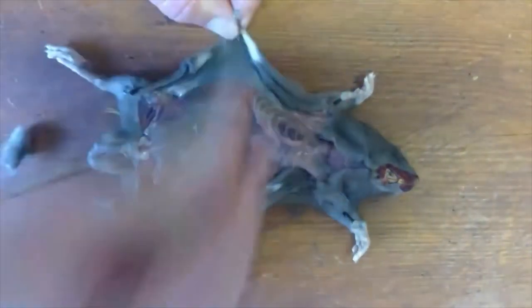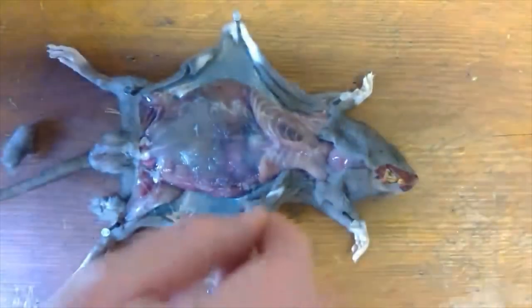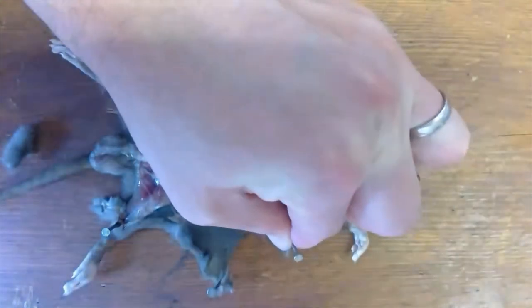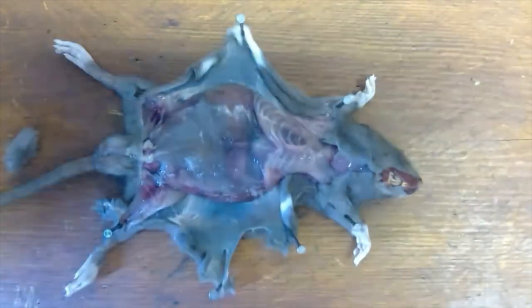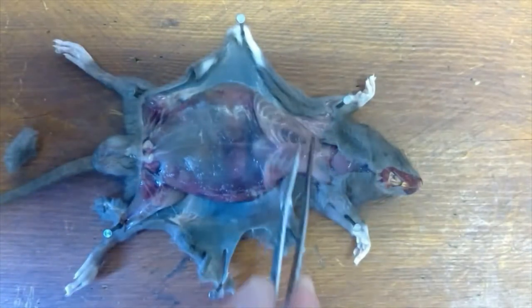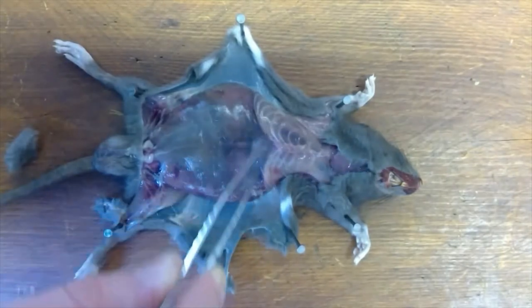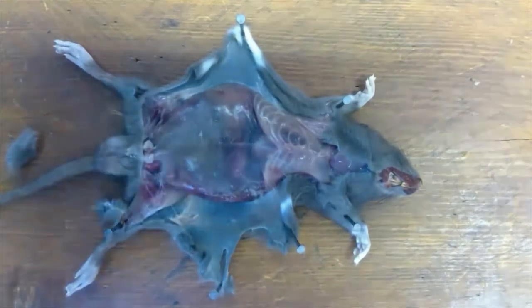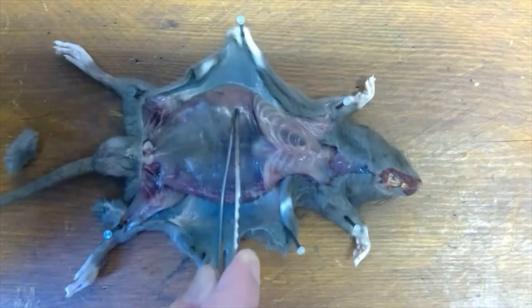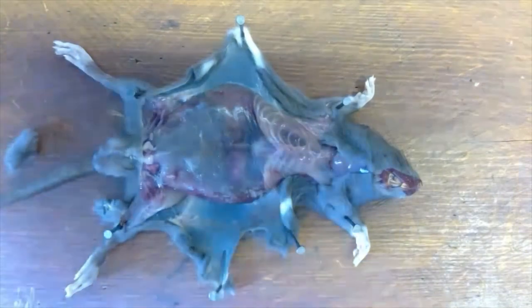I'll nail that in just so we can keep tension on it at all times, then pull on this side, allowing me to expose the organs on the inside. What we can see now quite clearly are the two cavities within a mammal: the thoracic cavity at the top, with the rib cage defining its boundaries, plus the diaphragm sitting beneath — that's involved in breathing. And then here is the abdominal cavity, which contains the organs of the digestive system and also the organs of the urinary excretory system. So without further ado, let's get stuck into the cardiovascular system.